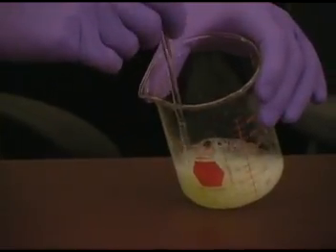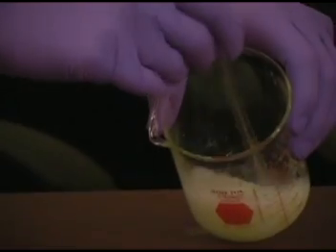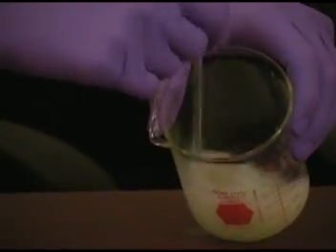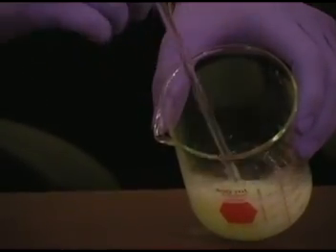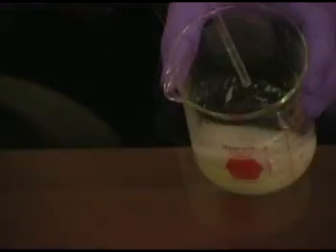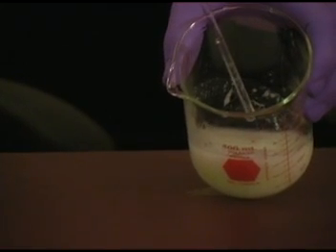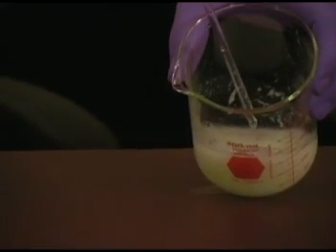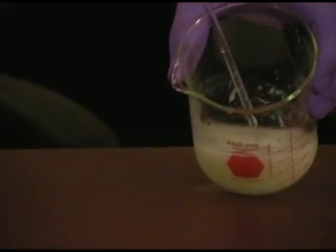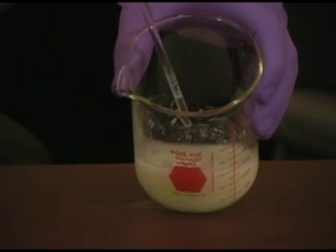The denaturation process is very similar to what happens when you heat it up. It takes a little while to cook an egg on a stove too, but it's going pretty quickly. You can see the white is starting to form.